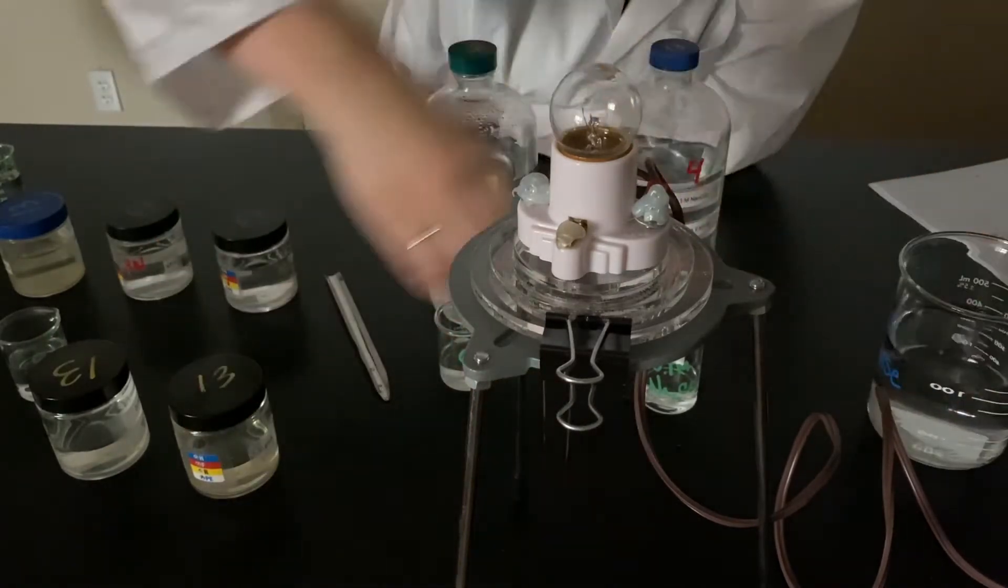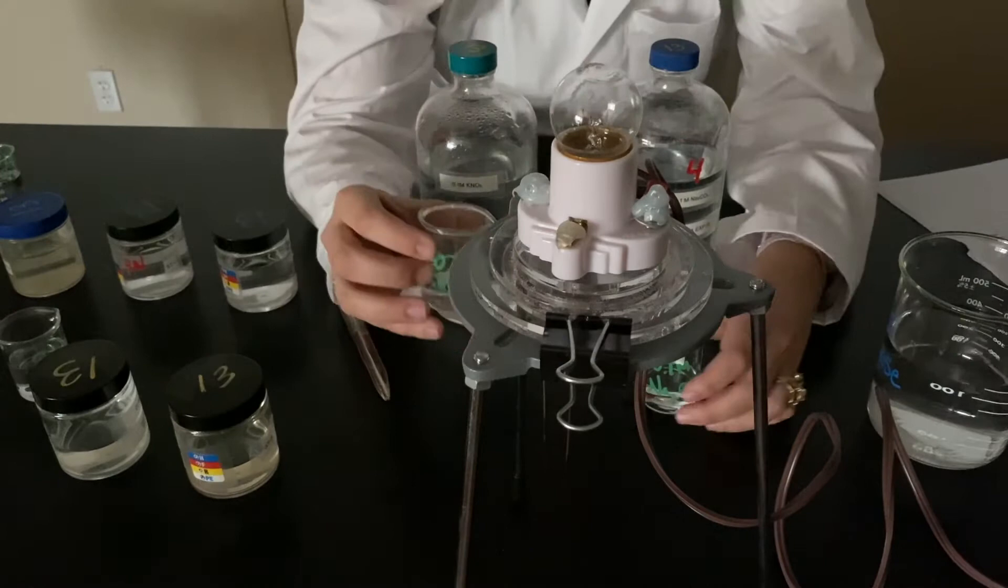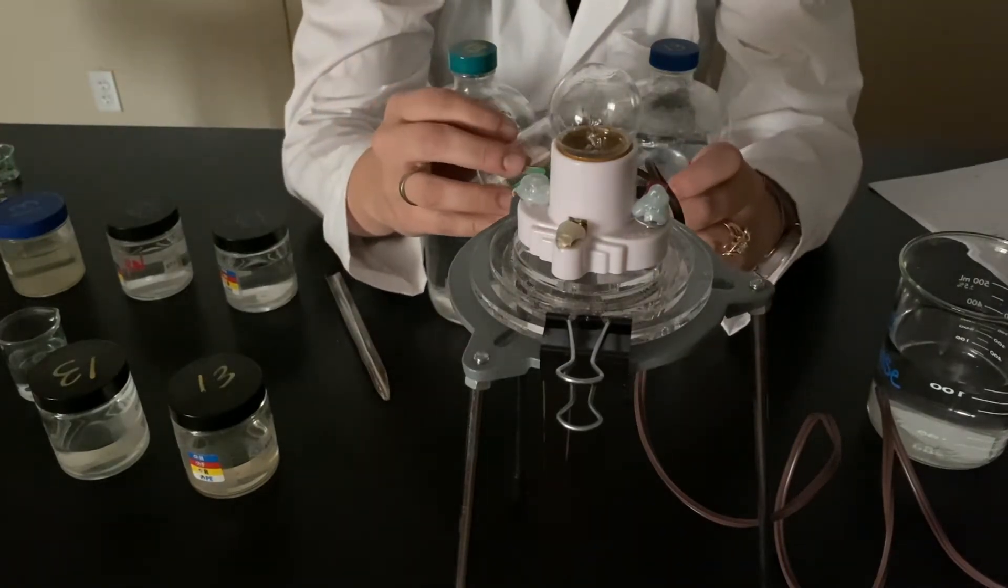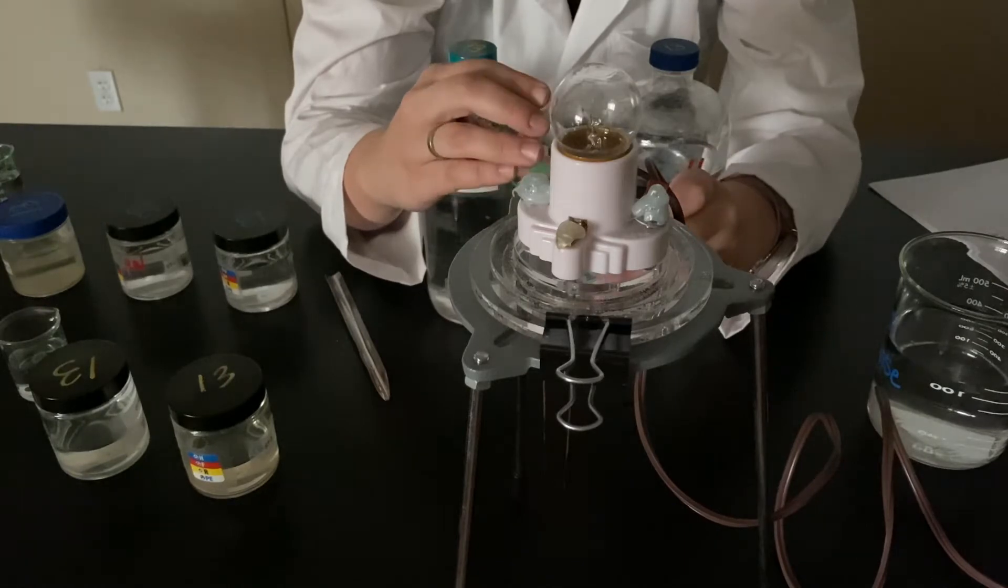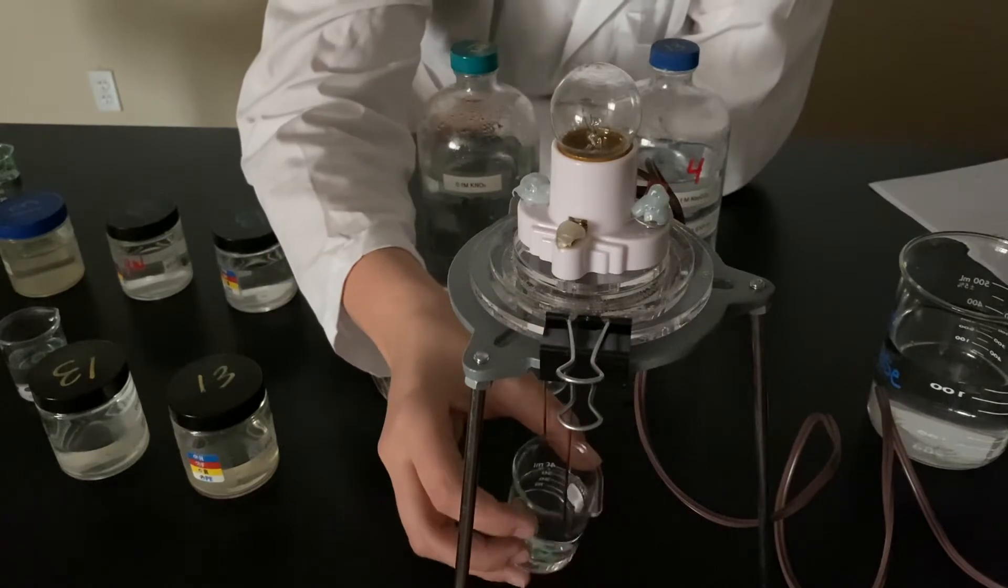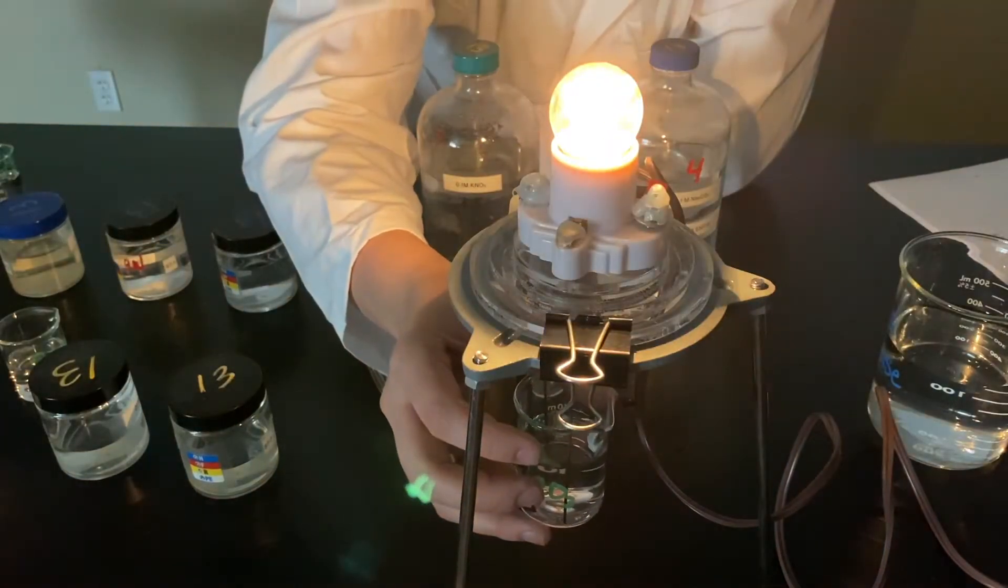Mix them both together. So I'm going to pour my potassium nitrate into my sodium carbonate solution. And it still lights up.